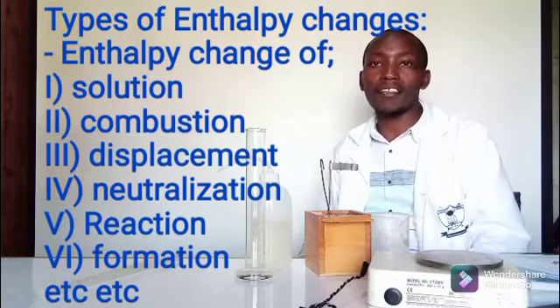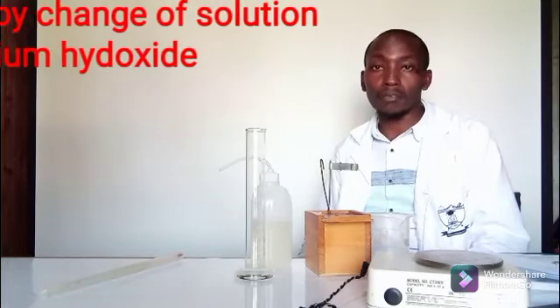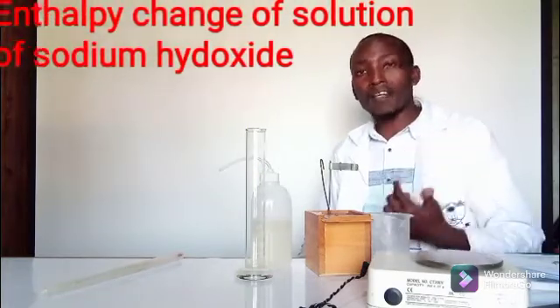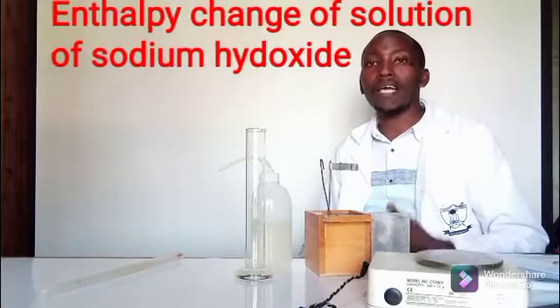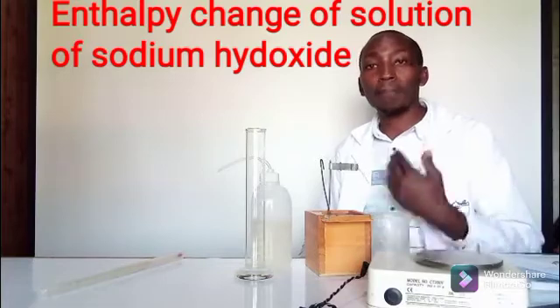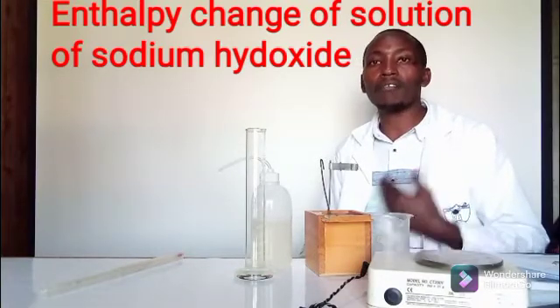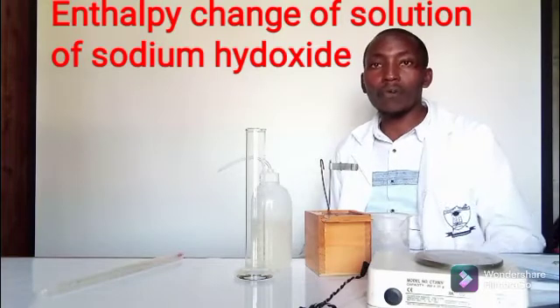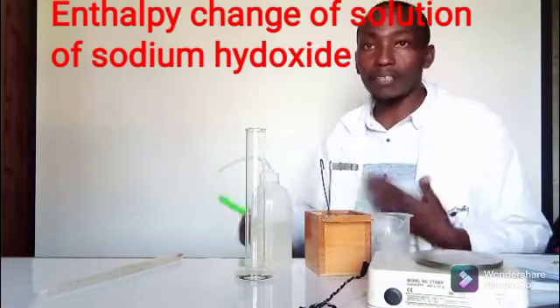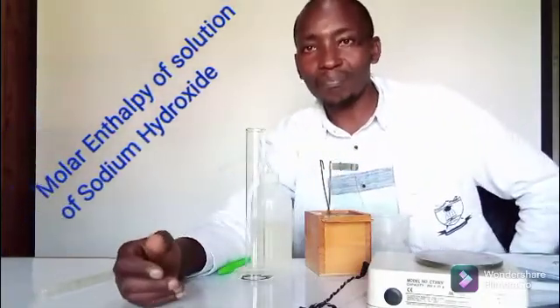Today we want to do the enthalpy change of solution — specifically, the enthalpy change of solution of sodium hydroxide. That is basically to determine what amount of heat occurs when you dissolve sodium hydroxide in water, and later this will help us come up with what we call the molar enthalpy of solution.